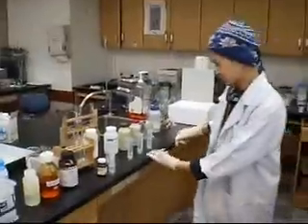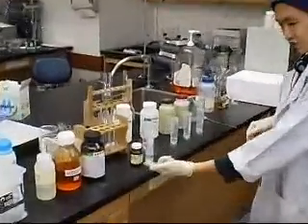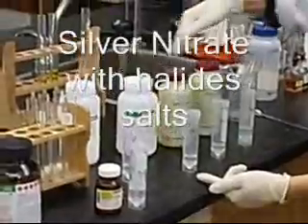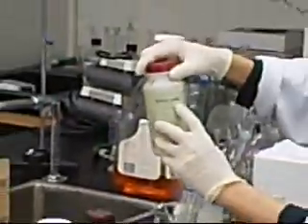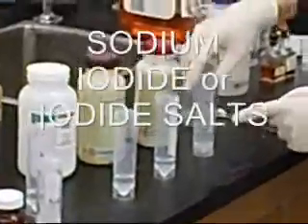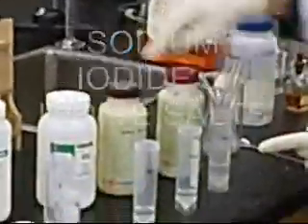This video tutorial is on the reaction of silver nitrate with all the halide salts. I dissolved sodium iodide in water to get a colorless sodium iodide solution.